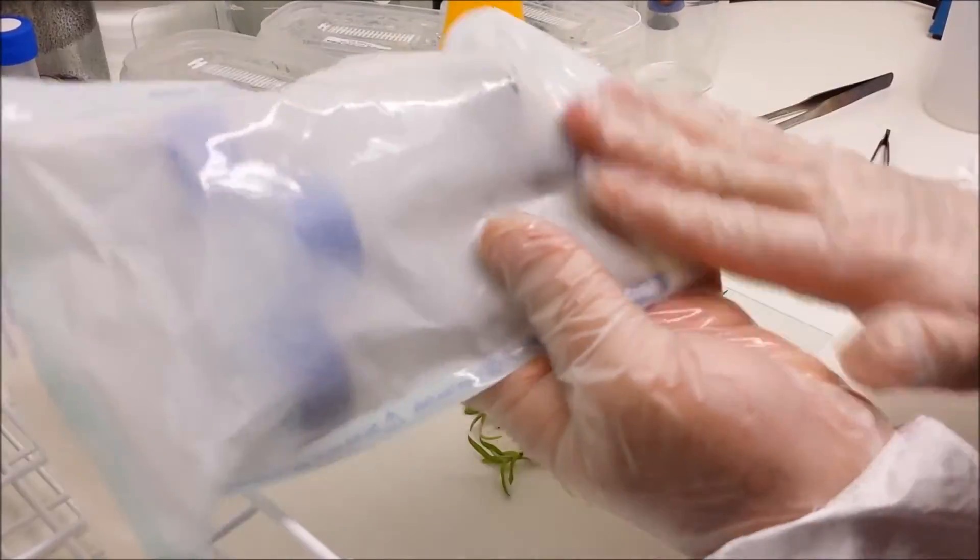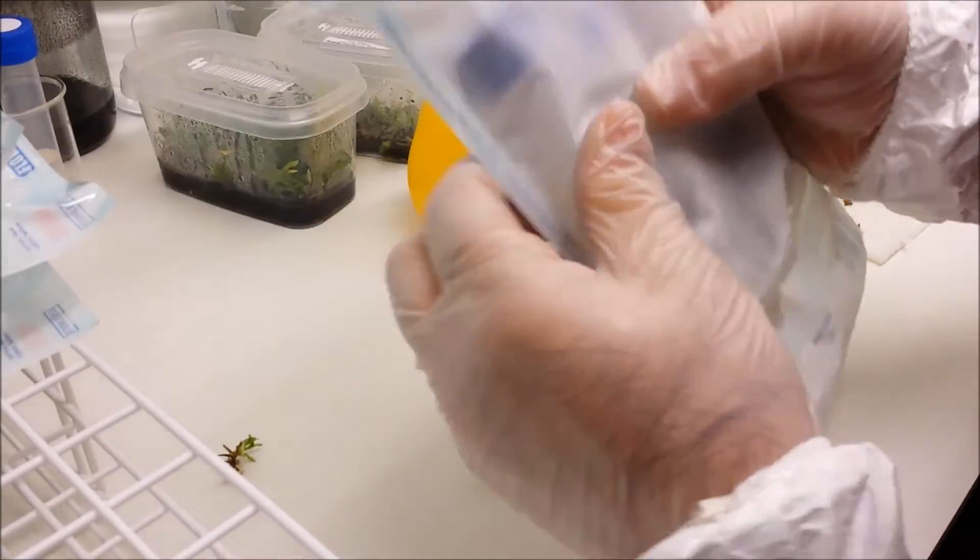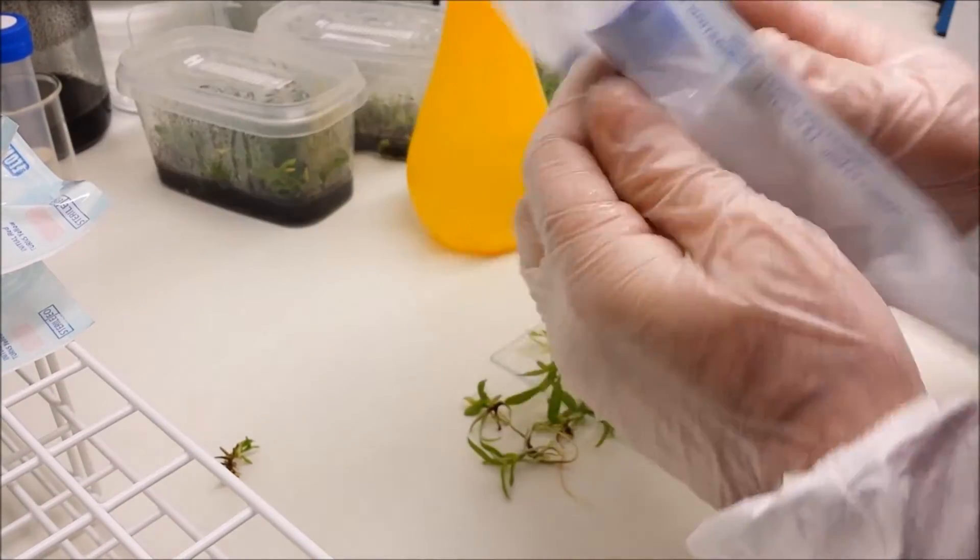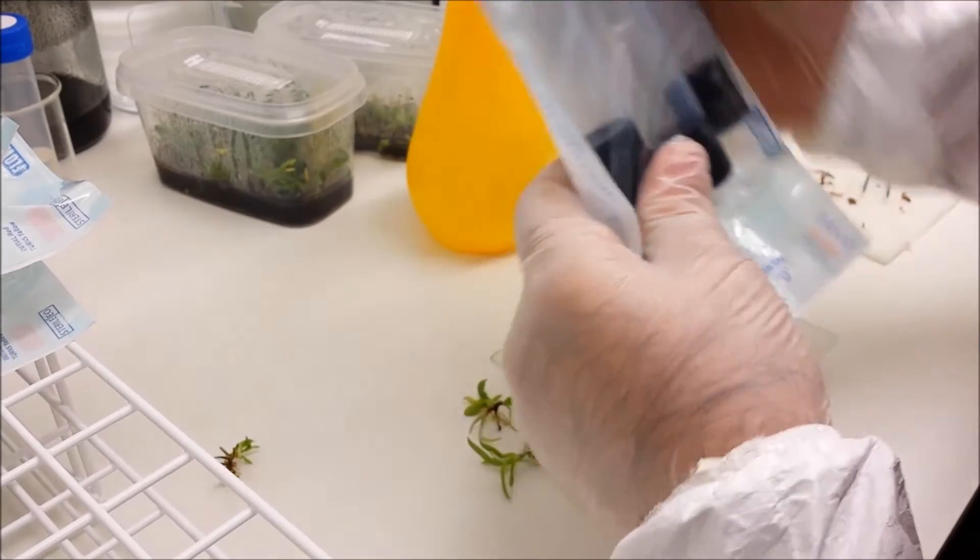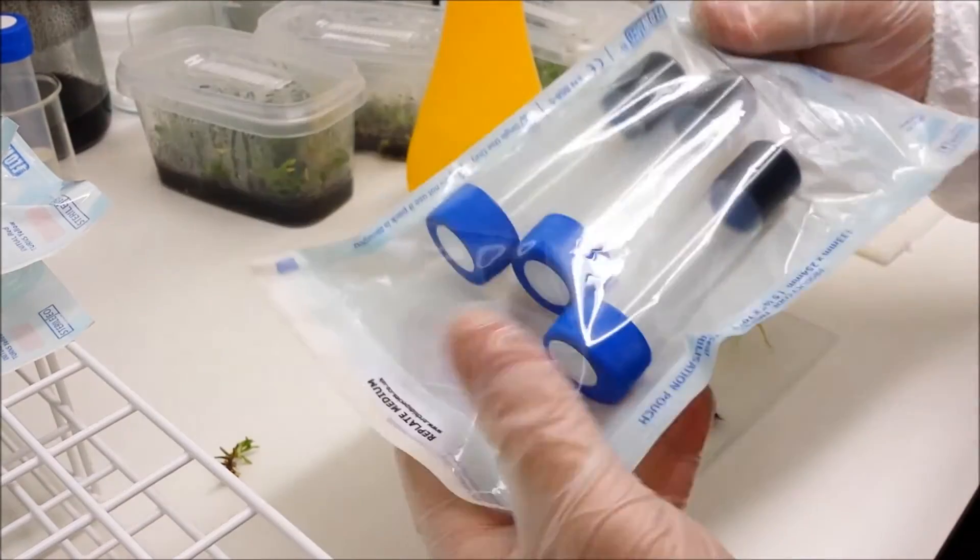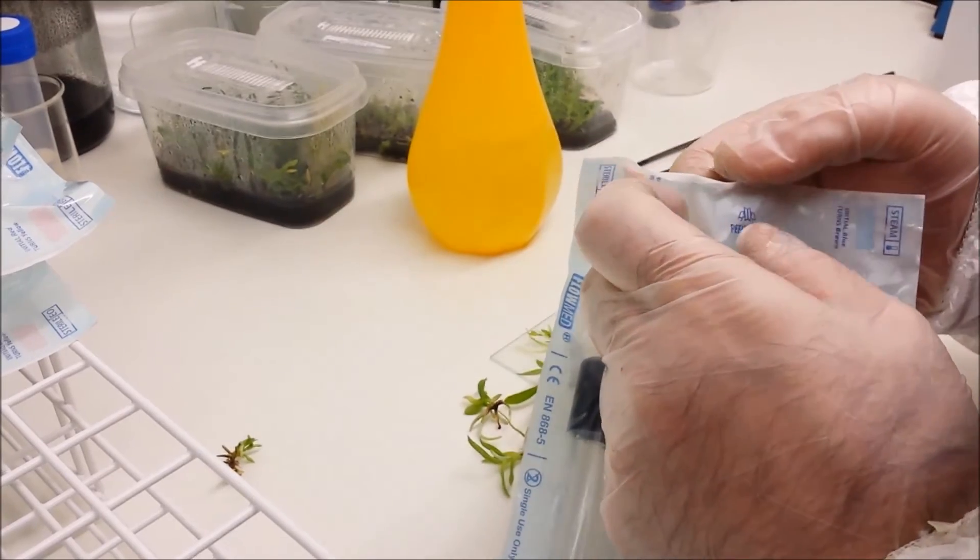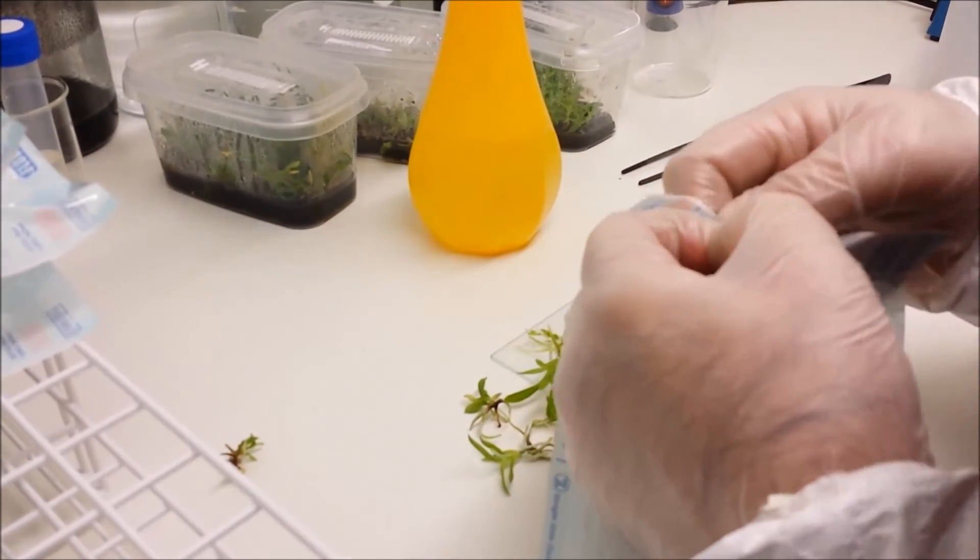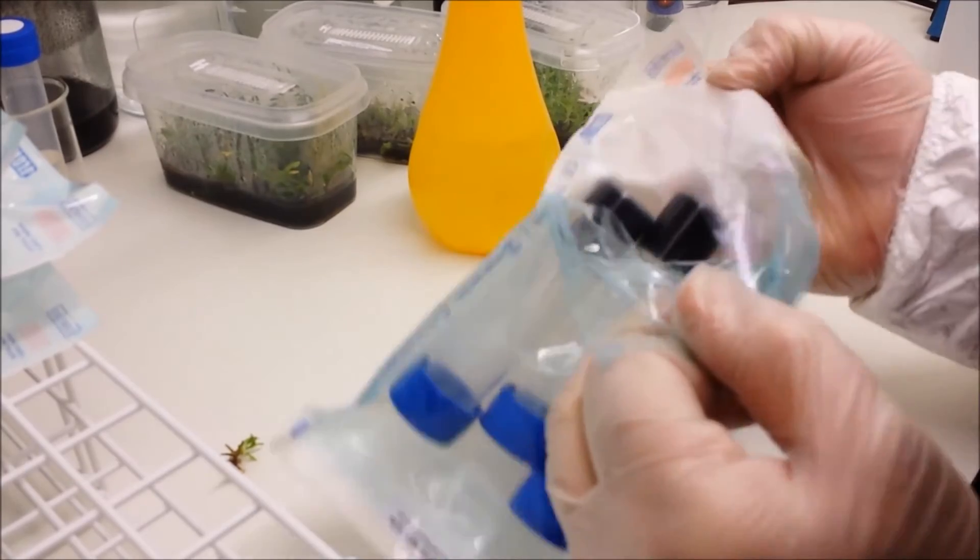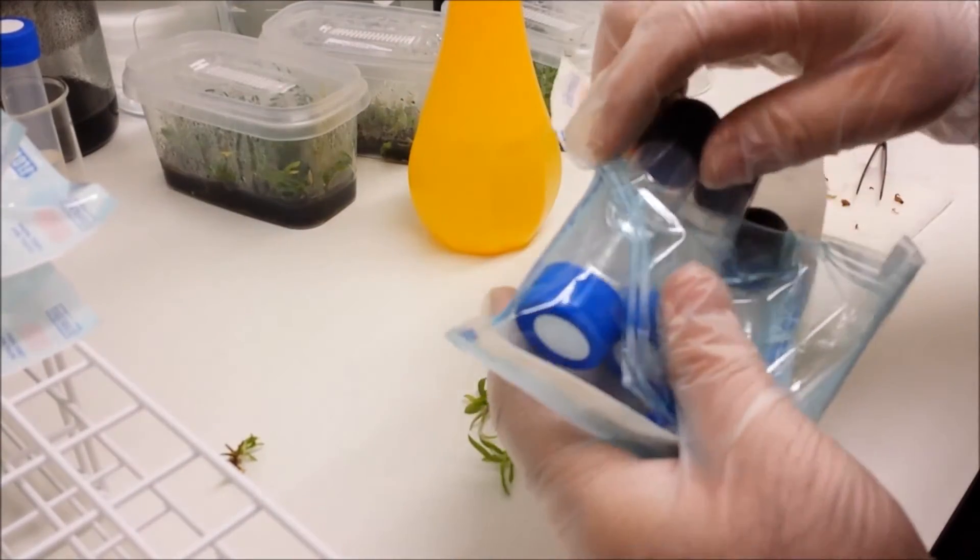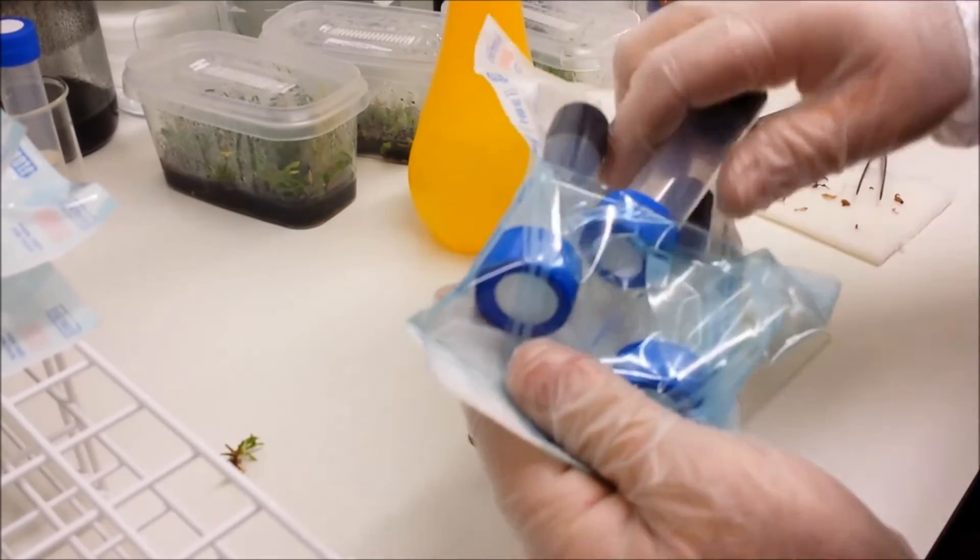Now available in replate, which is these, seeds for planting your own orchid seeds, and for stem propagations. Now I'm wiping these packets down. Bear in mind I've already done this once, but I need to remind you how important it is so I'm showing it again. I've sprayed the entire packet down front and back with IPA and I've rubbed it into all the creases and cracks and what not.